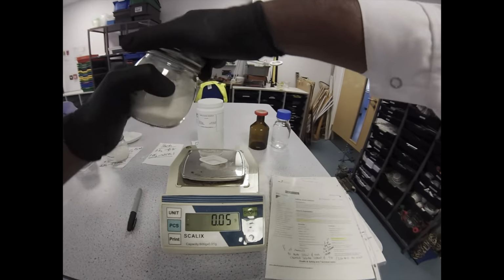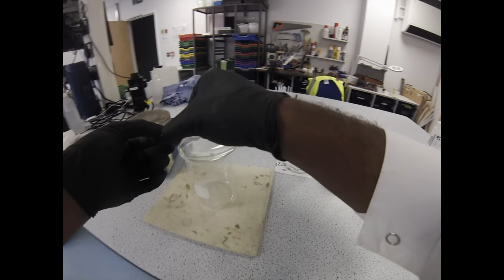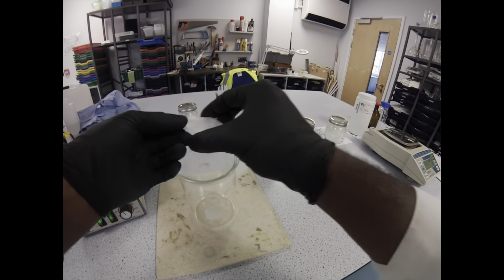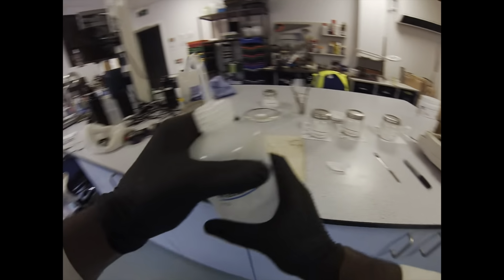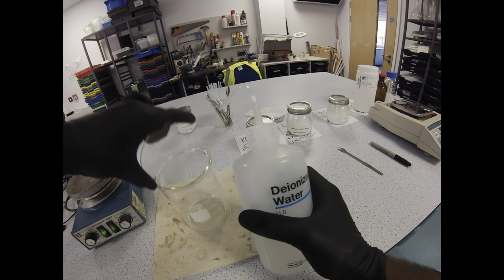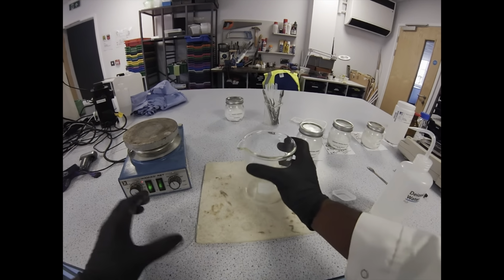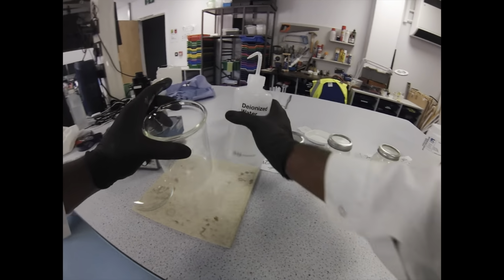The starch goes into the thick-walled beaker with a minimal amount of water. We're aiming to form a kind of thin slurry of starch and water, and then as we heat it, that'll go clear. We can top it up with a bit of water, and then we can start adding the rest of our powders. Forgot about the watch glass, but we'll ignore that. Being pretty generous with the rinsing as well because we're using so little starch. I want to try and make sure I get every single grain of starch onto there. Such a small mass of powder, it's really hard to actually see it in there, but it is in there.